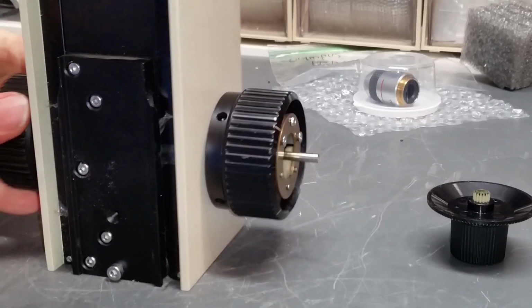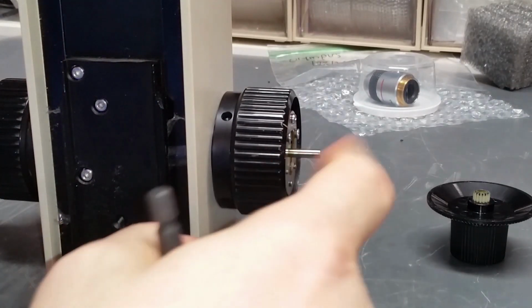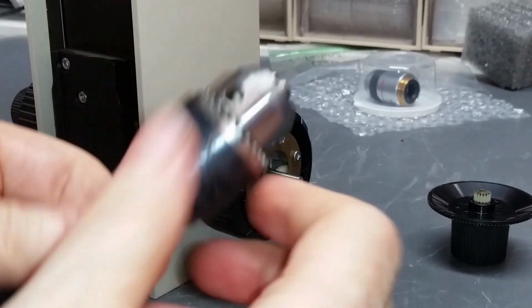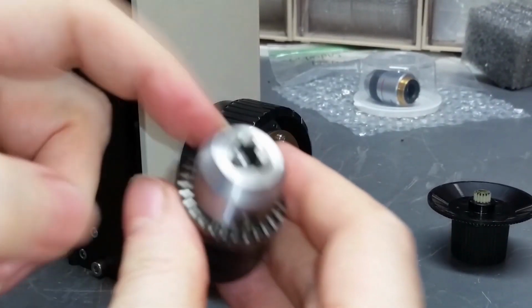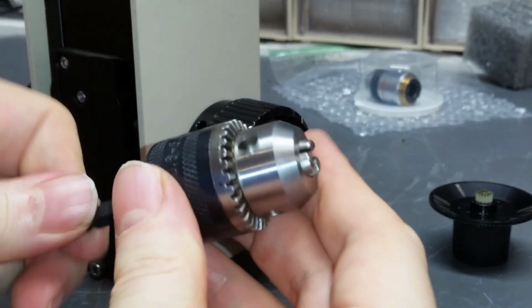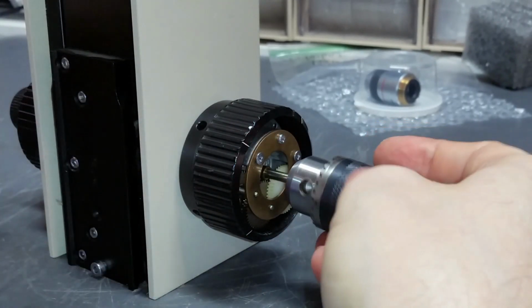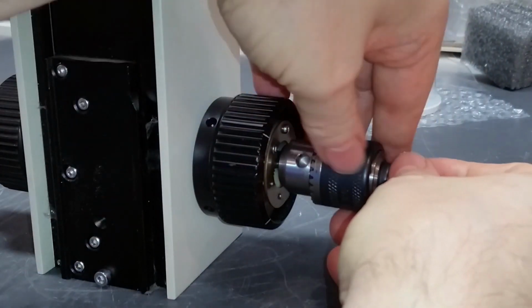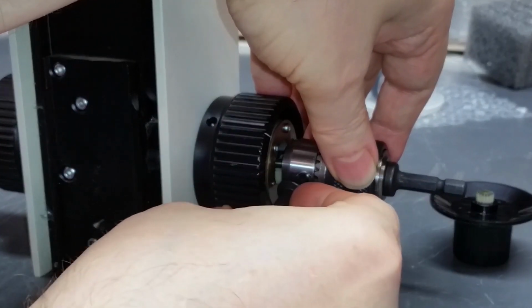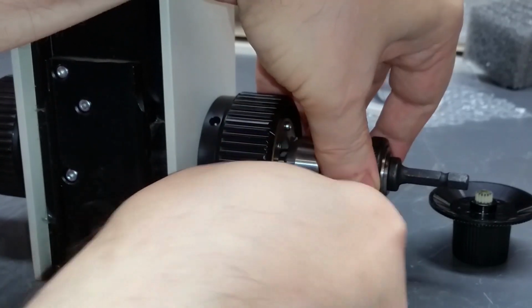So there's a couple ways you could determine where the bend is, how bad it is, or whatever. You could put a machinist dial indicator on there, and you could rotate it around, and you could do different things. But what I'm going to use is this little drill chuck type deal. Got a little hex attachment on it so that you can put it in like a drill driver or something. What I'm going to do is I'm going to just put this over the shaft, then take the key. I'm going to just tighten it down a little bit. It doesn't have to be real tight, but just tight enough that it doesn't go anywhere.